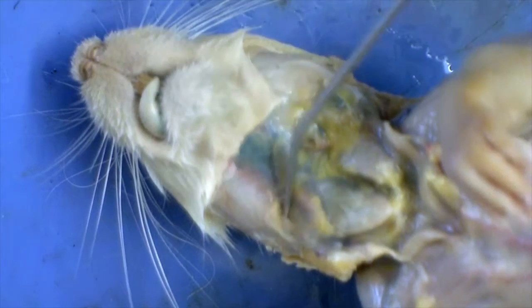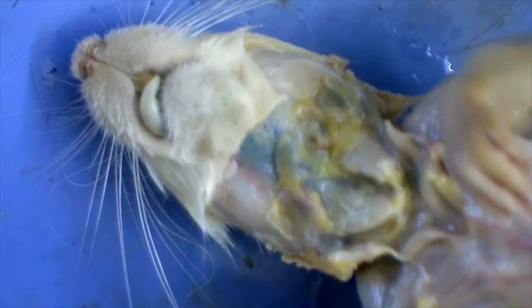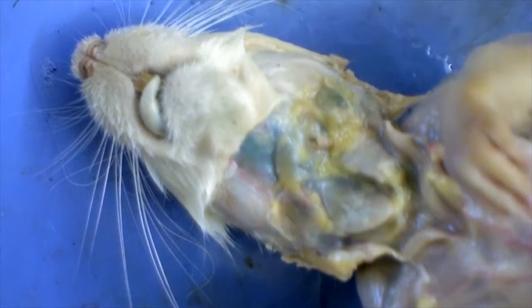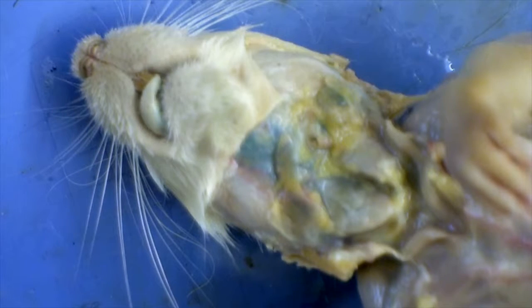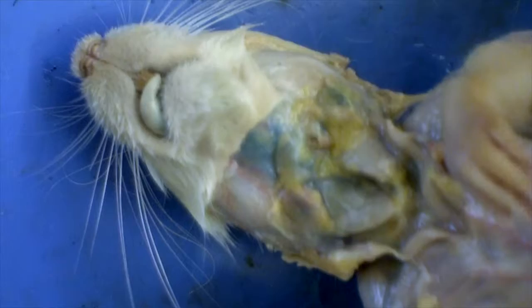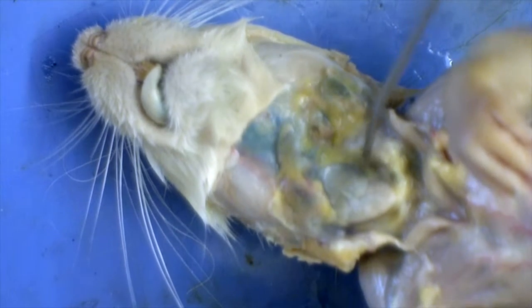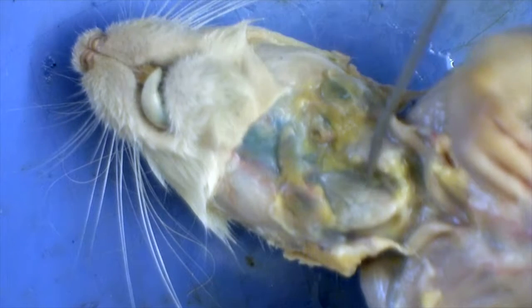And you can see some glands here also located in the neck that cover up some of the muscles that are located underneath. These muscles include the sternohyoid, the omohyoid, and the sternomastoid. They're all located under these glands. They're kind of hard to see. If you pull the glands around, you can see some things in them, but not a whole lot. They're located right in here, under these two glands here.